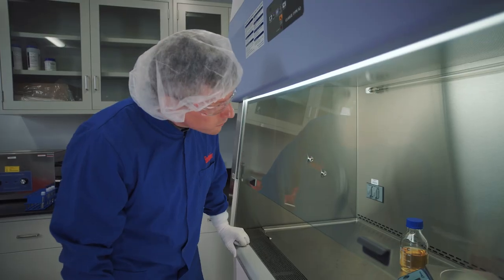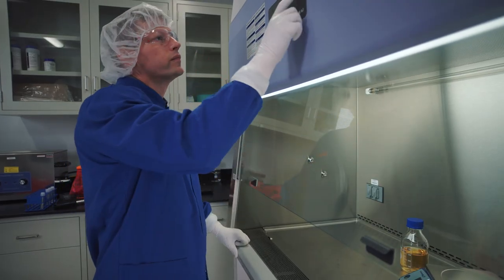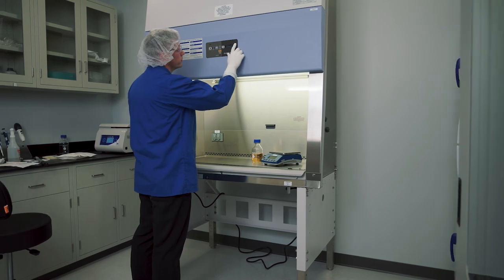Cleaning validation. The validation program should be carried out by the operators of the biological safety cabinet or suitably trained personnel according to a validated standard operating procedure.